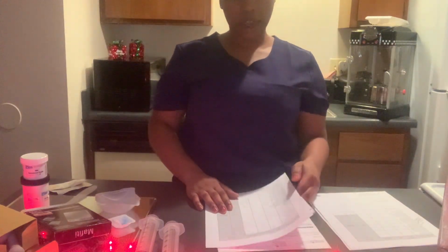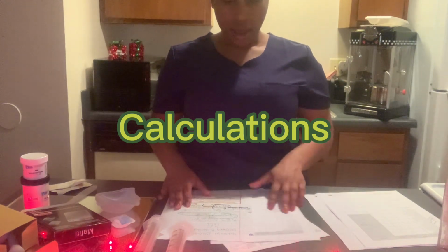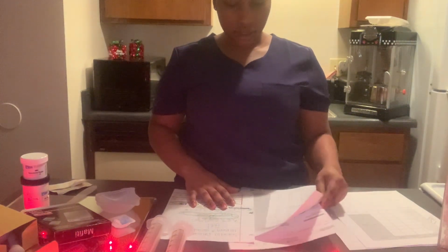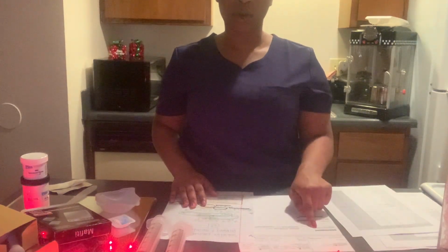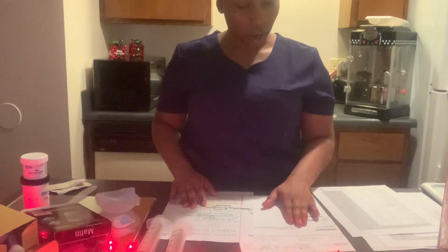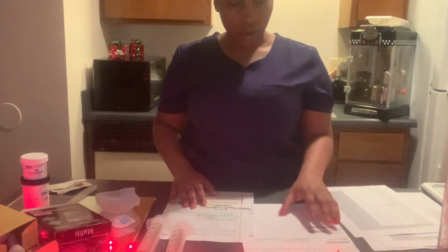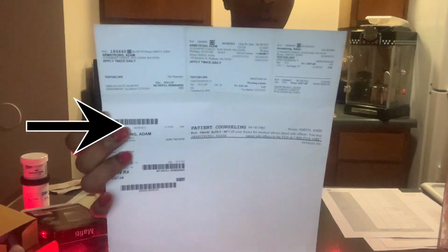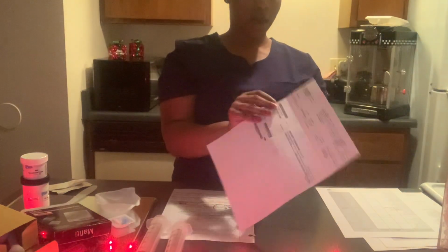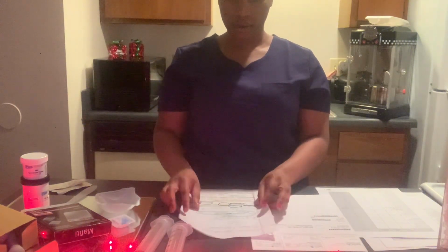So, first we have to perform our calculations and then explain our calculations. Today our patient name is Adam Armstrong, and we are preparing a testosterone gel. These are the prescription labels that we have, and I have my calculations right here.